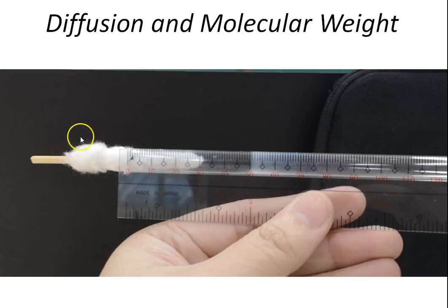So now we are on the left side, the hydrochloric acid side. You can see that this is the end of the glass tube, and here is the white precipitate ring. So what is your measurement? Can you see that?